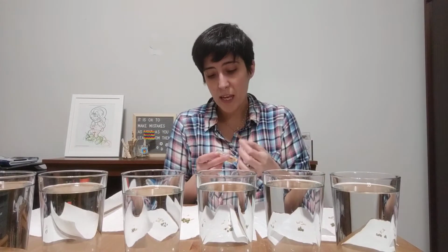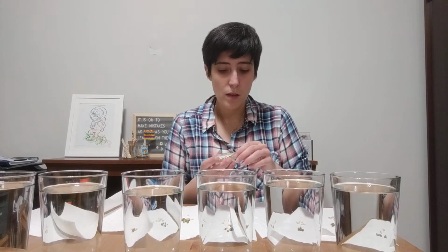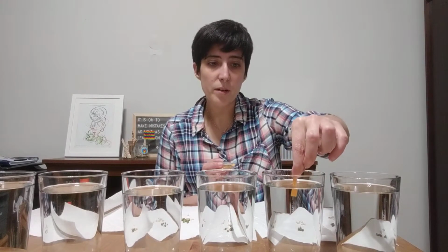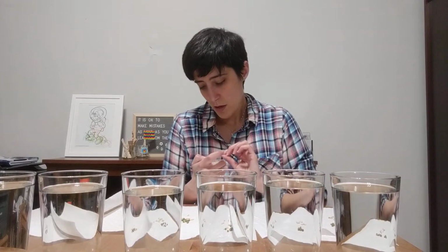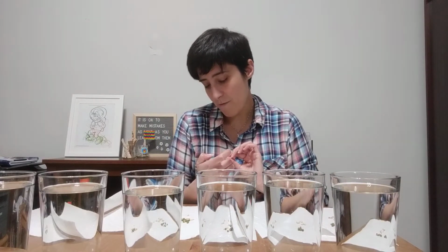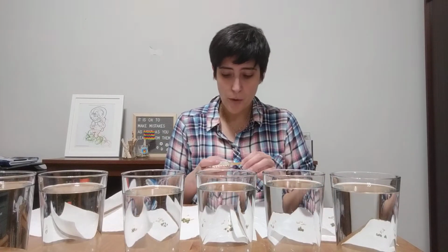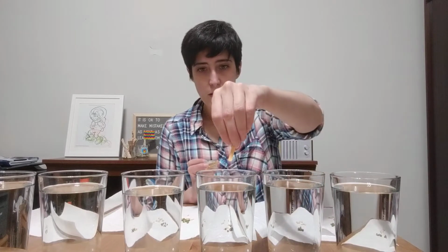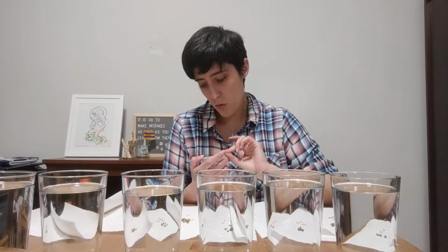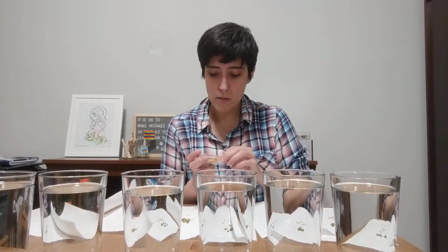So our pH there is right about 6. This one just had a little bit of vinegar. And the pH is still, it might be down in 5. It's a little bit oranger, not by much though. All right, this one had 25 mLs of vinegar. You can see it's starting to get more orange. That's probably about 4, maybe a 3.